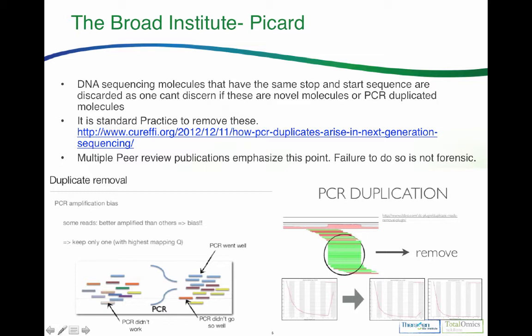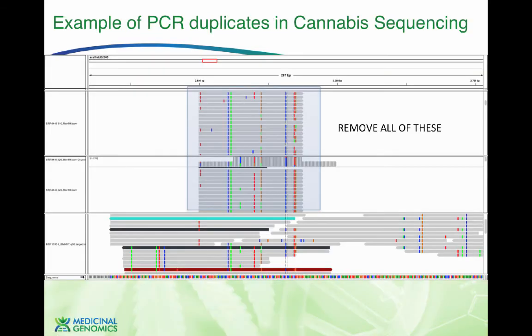So this is important to know, because what we're seeing in a lot of the data that's out in the cannabis industry right now is that it looks like this. They are designing PCR products that they're sequencing, and in any professional genome center, all of this data would be thrown out. It would never be utilized, yet this is being sold to customers in the cannabis space.